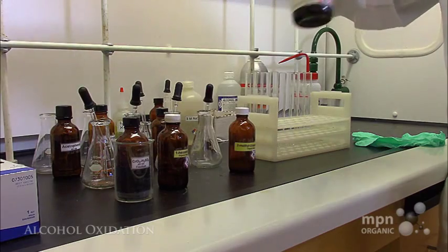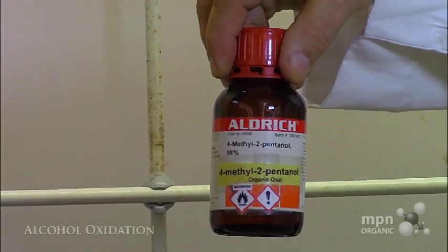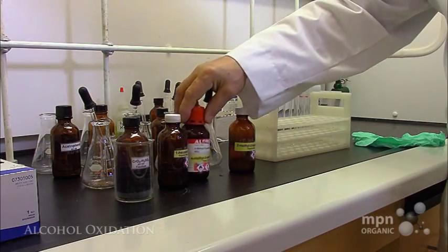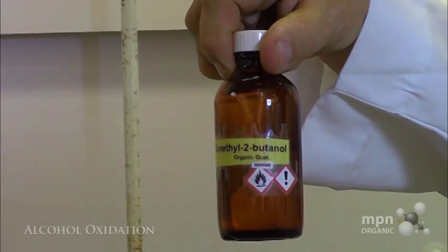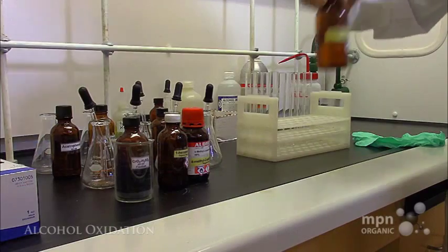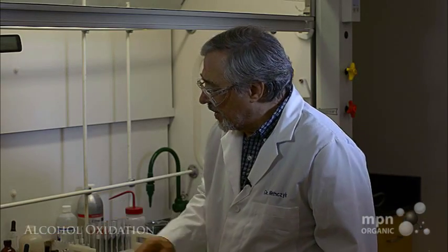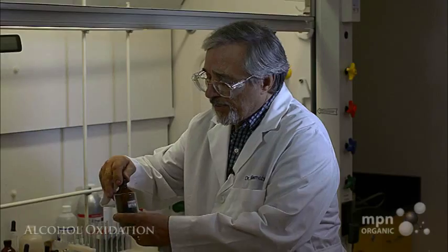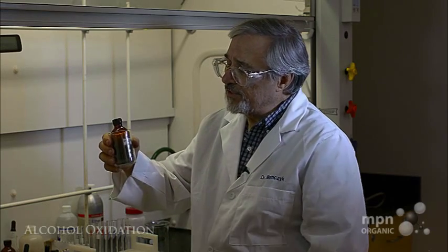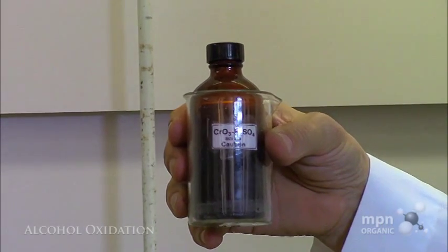The three alcohols that I'm going to test are a primary alcohol, 1-hexanol, a secondary alcohol, 4-methyl-2-pentanol, and a tertiary alcohol, 2-methyl-2-butanol. These are all conveniently liquids, but I presume this could be done with solid alcohols, although that's for another day. We're going to use for our test chromium trioxide, water, and sulfuric acid.